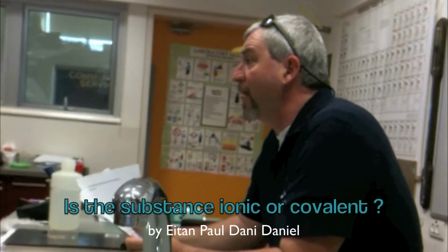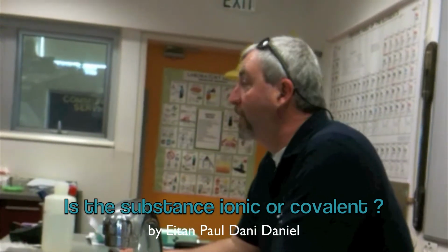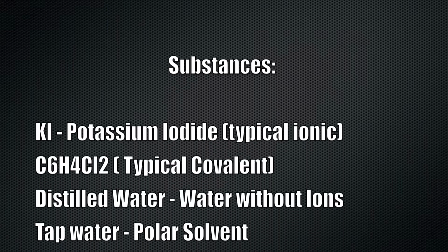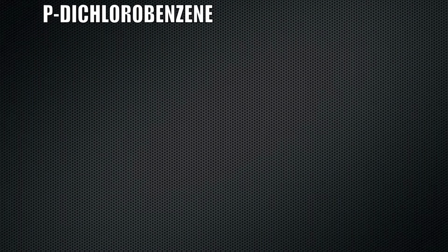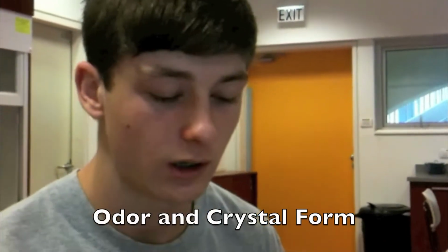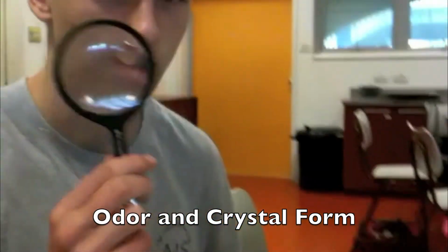So what we're going to do is start a lab today that deals with whether a substance is ionic or covalent. The objective of part A is to familiarize ourselves with the substances, to see if they have an odor or not, and to test how they feel on the finger and how they look up close with a magnifying glass.